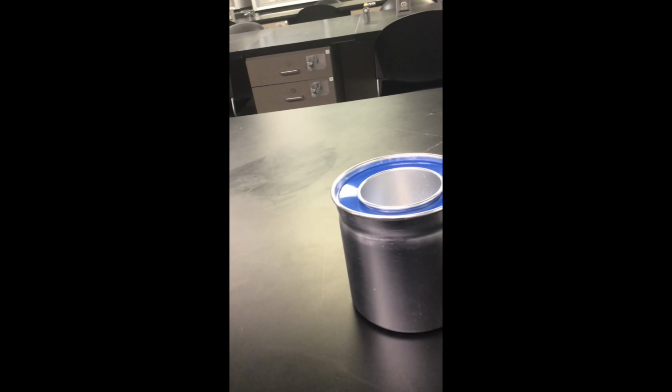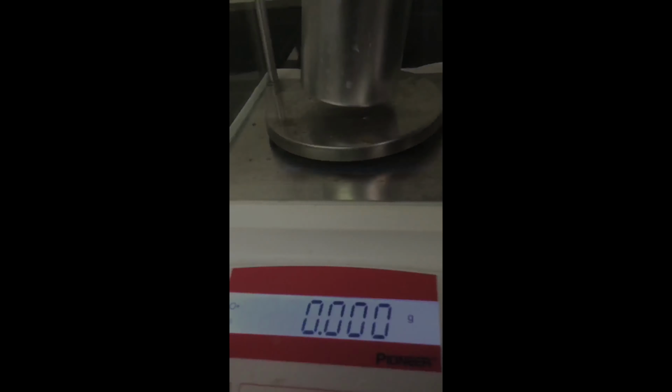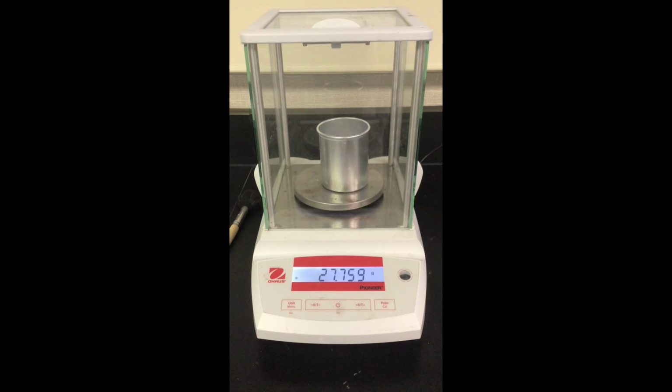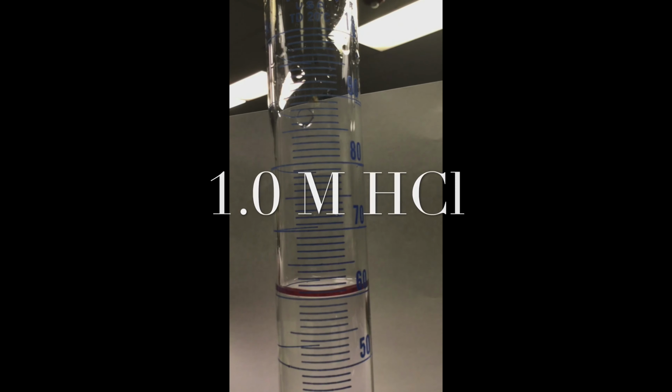The first step in this experiment is to weigh and record the mass of the calorimeter. Please pause the video and record the mass of the calorimeter. Next, we will measure out 60 milliliters of a 1 molar hydrochloric acid solution and add it to the calorimeter.